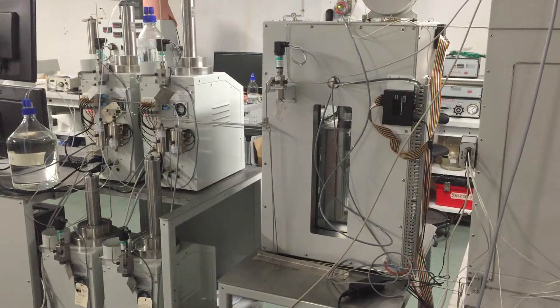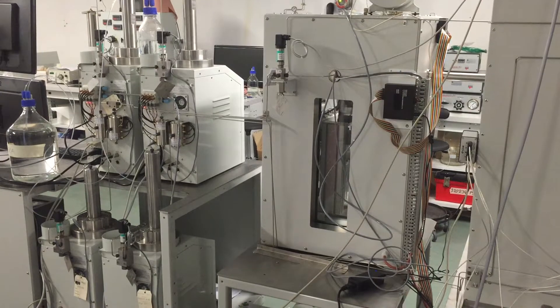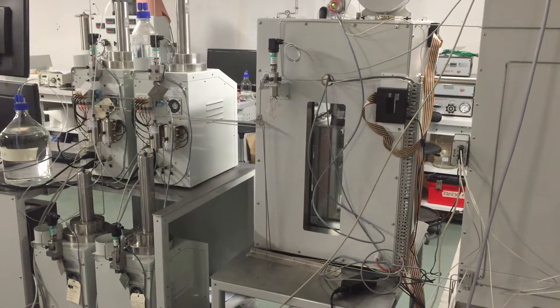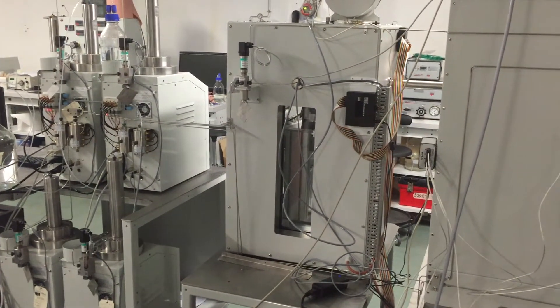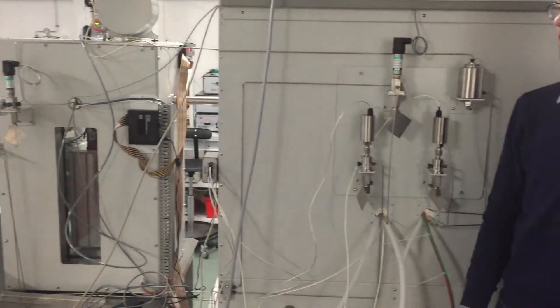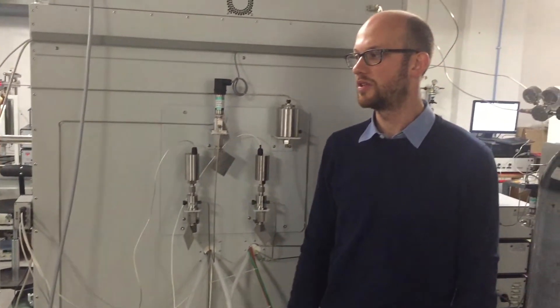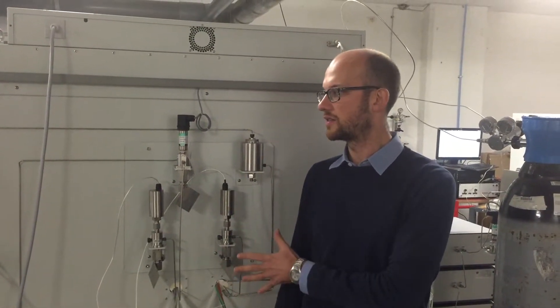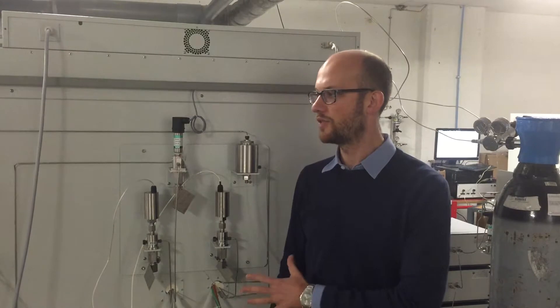As you can see, at the back of the system there are lots of connections. Yet everything is very easy and very user-friendly so that maintenance can be done very easily. We also have here everything that gives us information about the pressure on the system, and everything is connected back to the computer on the right side of the system.